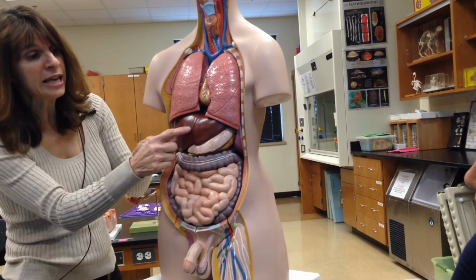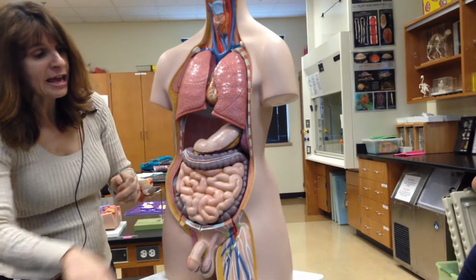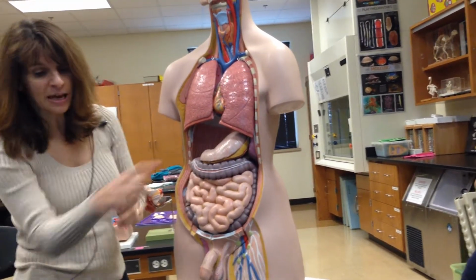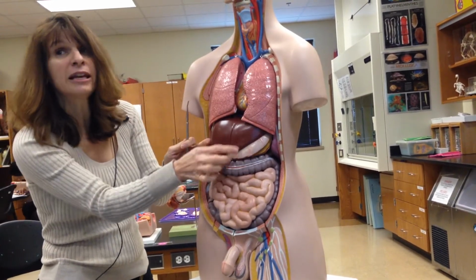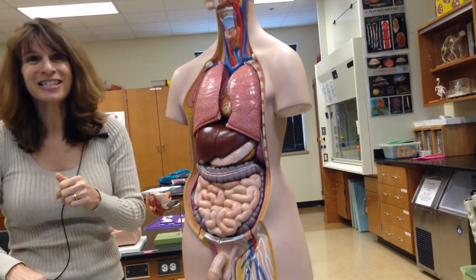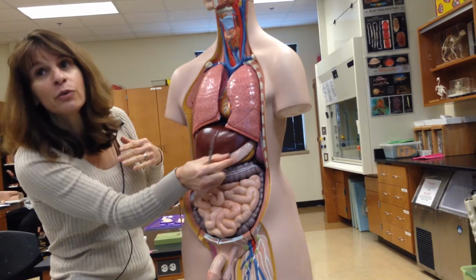Okay, so now we're going to take this organ out right here, the liver, so that we can better see this organ. Identify the organ. Stomach. Notice how you can just see it peeking out like that. That's what it's going to look like in our cats. That's what it's going to look like in your human patient, in MRIs and CAT scans and things. It's just that little sliver right there.